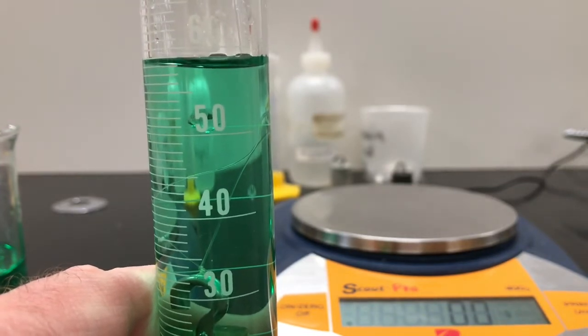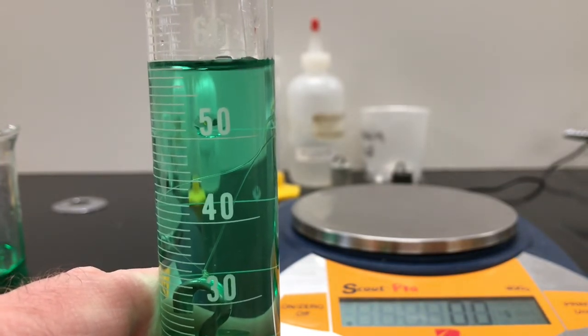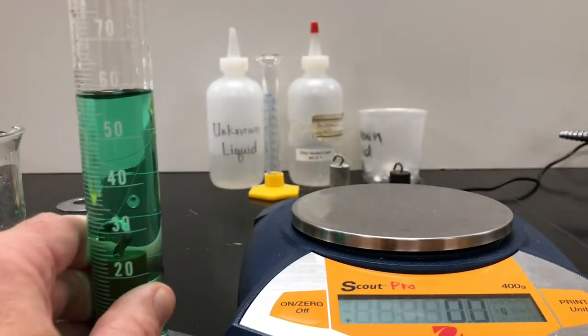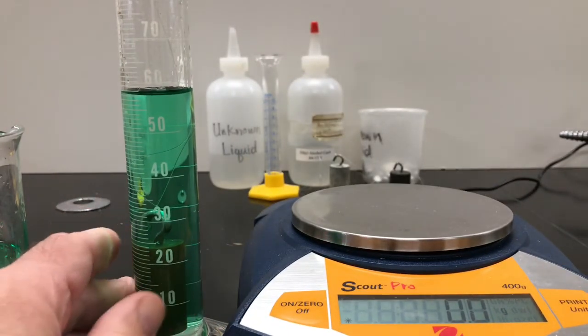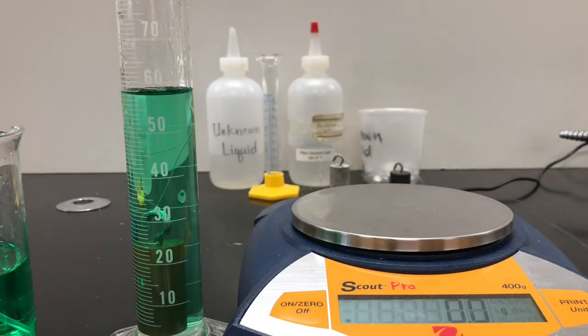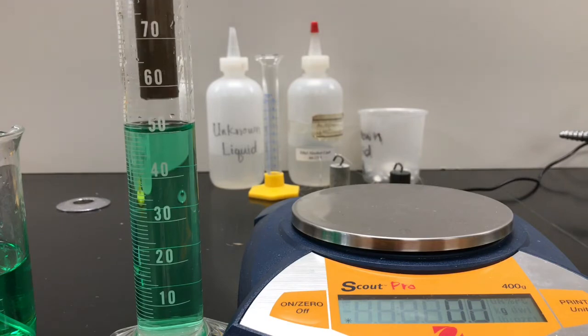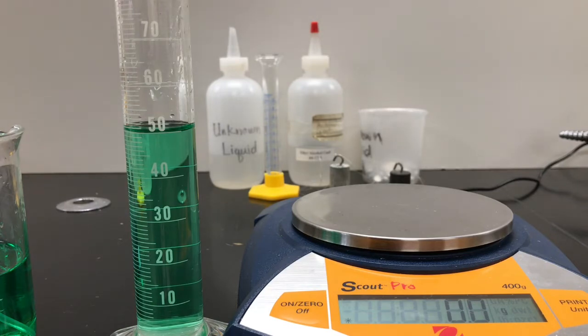So yeah, not 60. Between 59 and 58. I'm a little shaky here, sorry. So make a judgment call. Are you going to call that 59? You're going to call that 58? I'm thinking it's a little closer to 59. And so we take that out. So that one's done. Okay? And again, you have to complete the calculations.